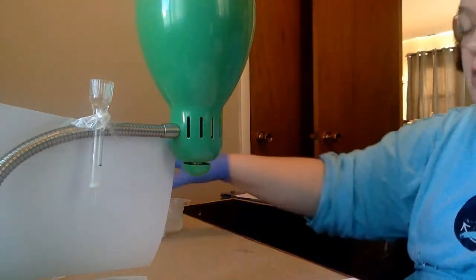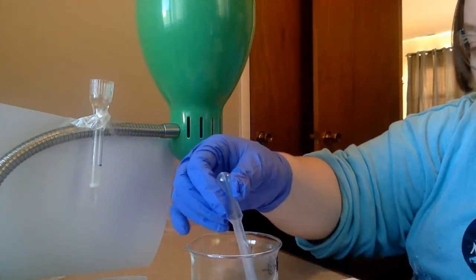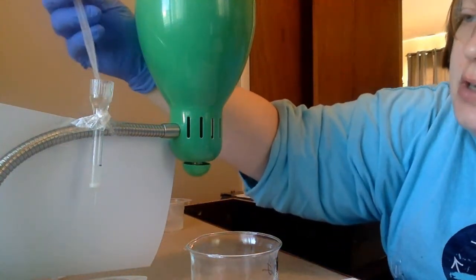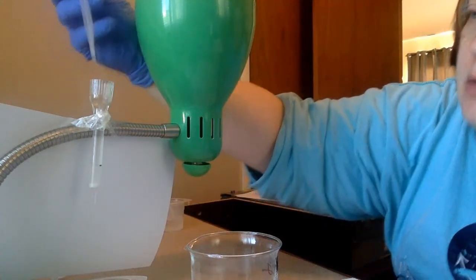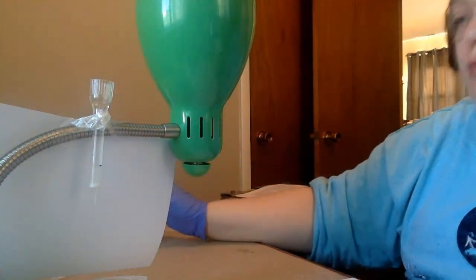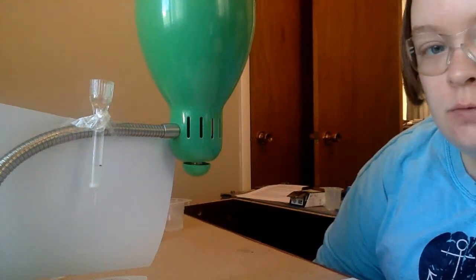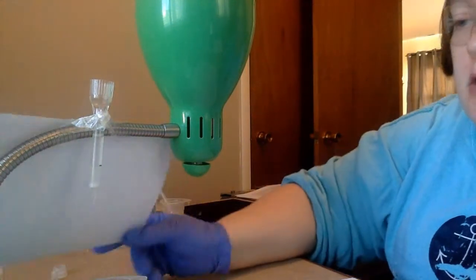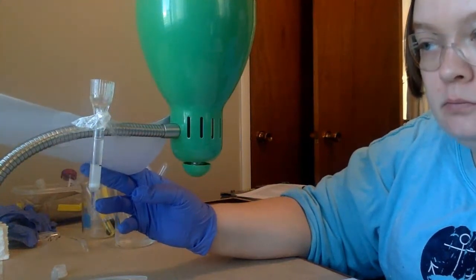Alright, so what I'm going to go ahead and do is add some more buffer here, and the reason I'm doing that is because I want to wash this out to ensure that there's nothing inside that's going to contaminate my results. So I'm going to add some more buffer there, and I'm just letting it wash through. Again, the goal is that this is going to wash out anything that may be residual from anyone who used this column before me. So I'm washing it out, and you guys can kind of see it dripping there when I move the paper back.